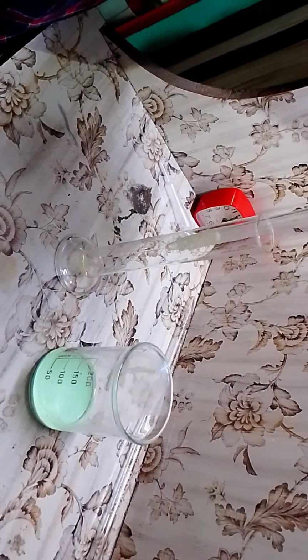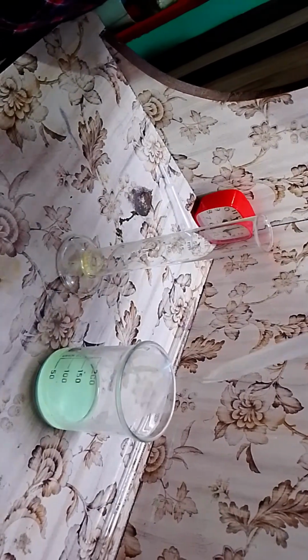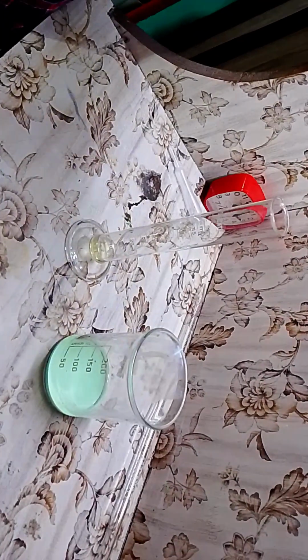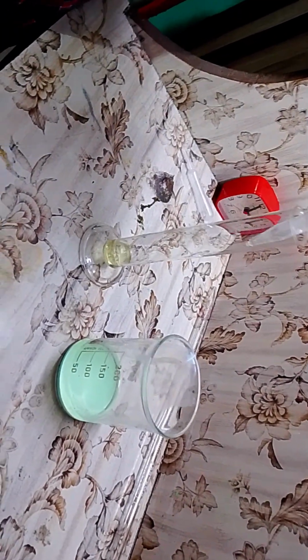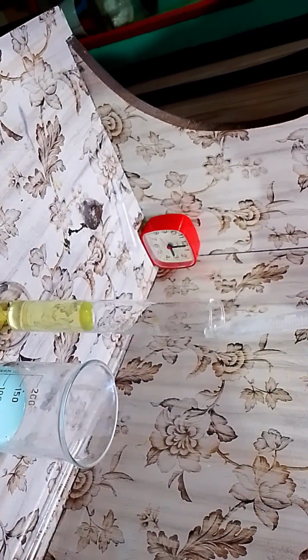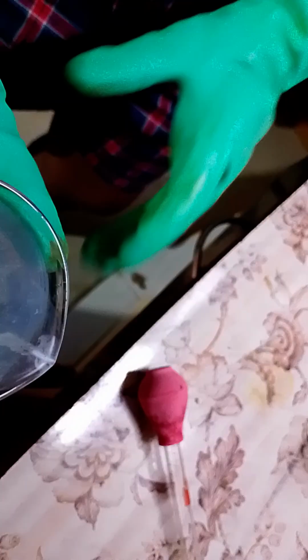You can see a little tinge of yellow in the acid. I have no other choice except doing this over and over. Okay, final drops have been given. You can see the copper oxalate in here, which is totally blue. I'll ask the cameraman to show it. Let me shake it. Now you can see it's totally blue. Okay, great.